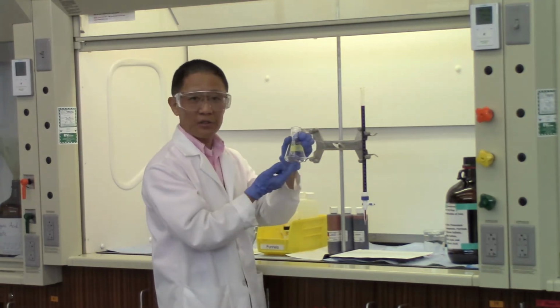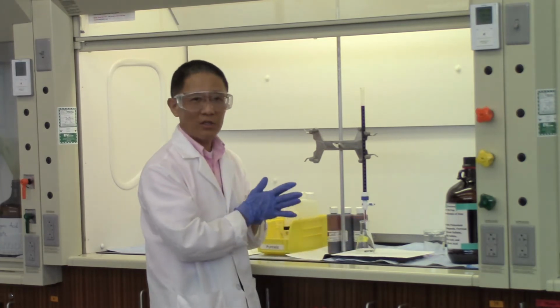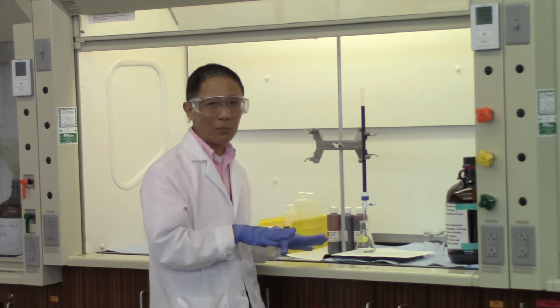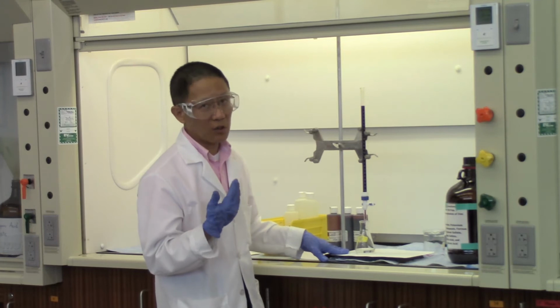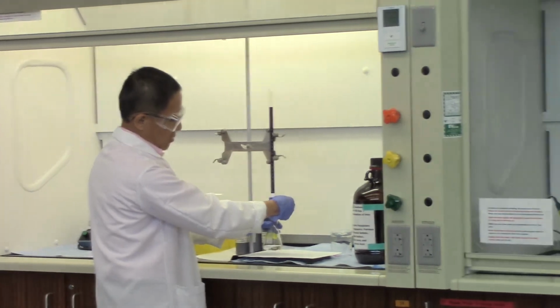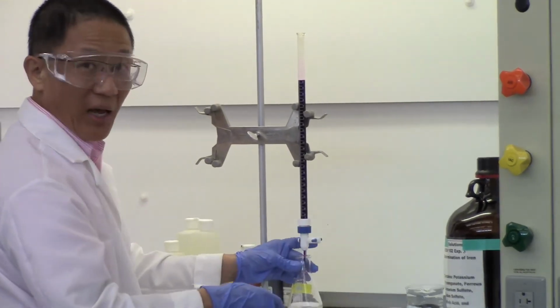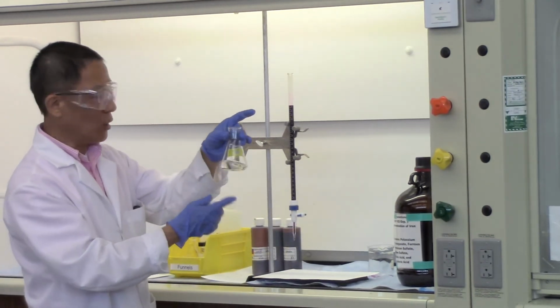We have a clear solution, everything dissolved in there. We're going to add potassium permanganate solution into the mixture there. And to visualize the color change a little bit better, we always recommend that you put a piece of white paper underneath the flask. Looking against a white background makes it easier for us to see the pinkish color. Okay? So when you do the titration there, and you open the stopcock and start swirling the mixture there, and you can see the persistence of the pinkish color. But if I stop adding the solution, and I keep swirling it, and you see that pinkish color disappear.